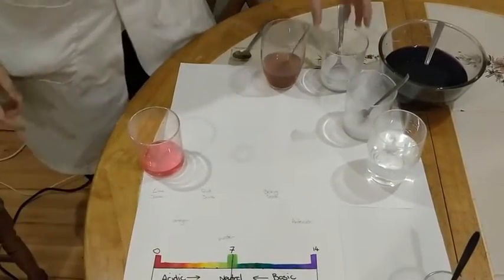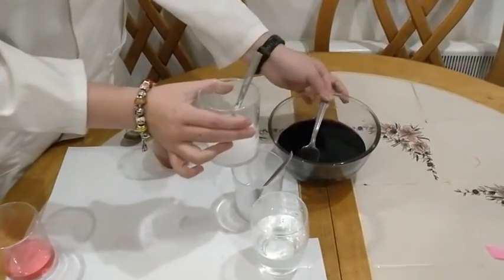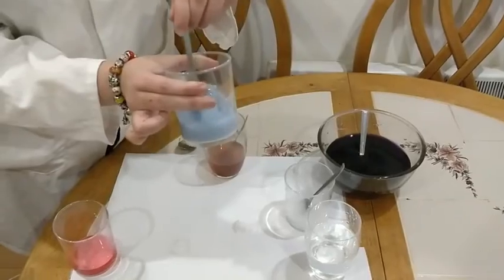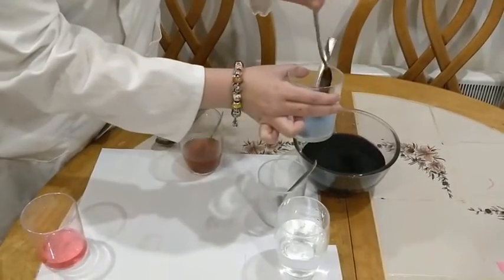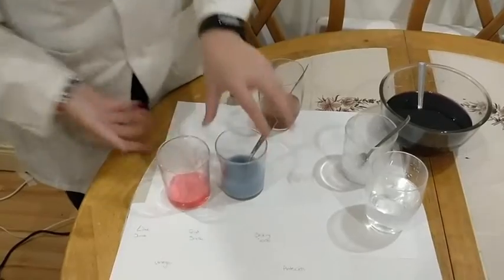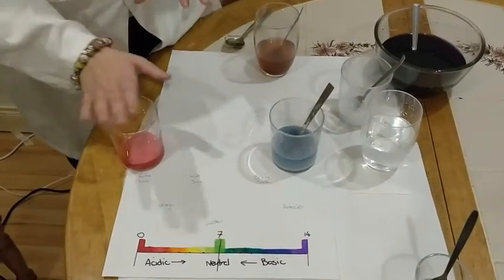Next, this one is our bicarb. I'm going to repeat the procedure. I'm going to add a spoon, and you can see straight away that this went blue. I'm just going to add a little bit more so we can get a better result, because it's good to be able to quantify our results. So we have a blue, and we can very clearly see the 2 different colours that occur at the different ends. I'm going to put the baking soda at one end, and I'm going to put the vinegar at the other end.